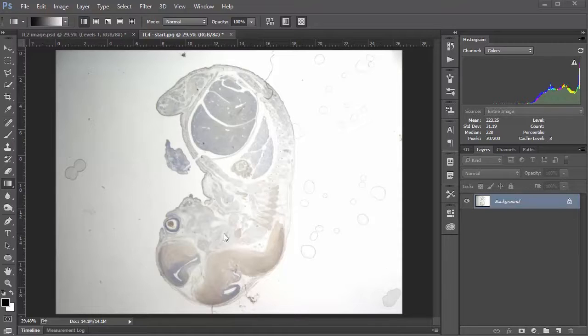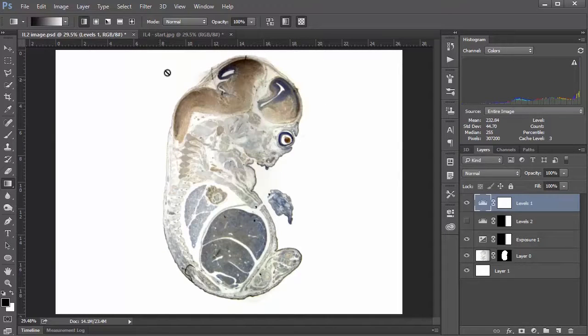In today's video, I'm going to be showing you how to take a very crappy looking bright field image. In this case, it's a slide I've taken with a dissecting microscope, and turn it into something a little more presentable, like we have here.